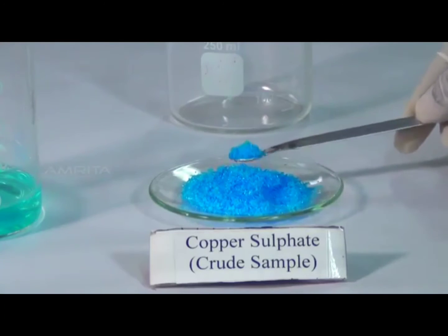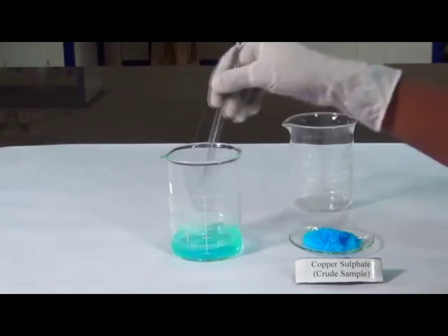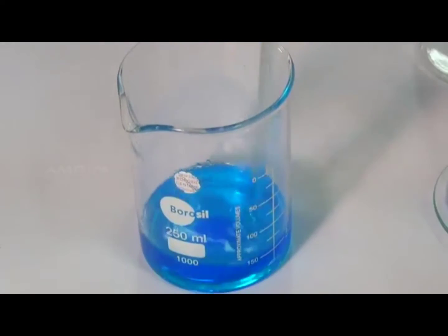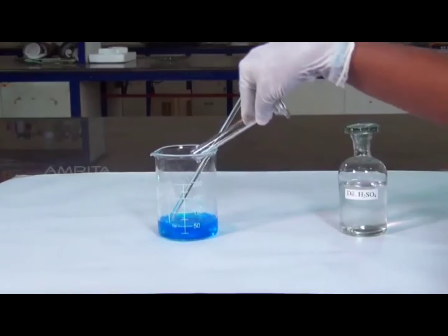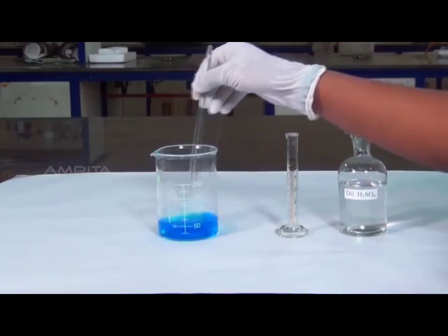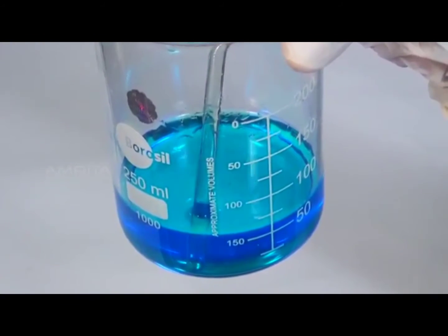Add the powdered sample several times till a little of it remains undissolved in the beaker, even if it is stirred for some time. Now, add about 3 ml of dilute sulfuric acid to the solution using the measuring jar and gently stir the solution to make it clear. This prevents the hydrolysis of copper sulfate.